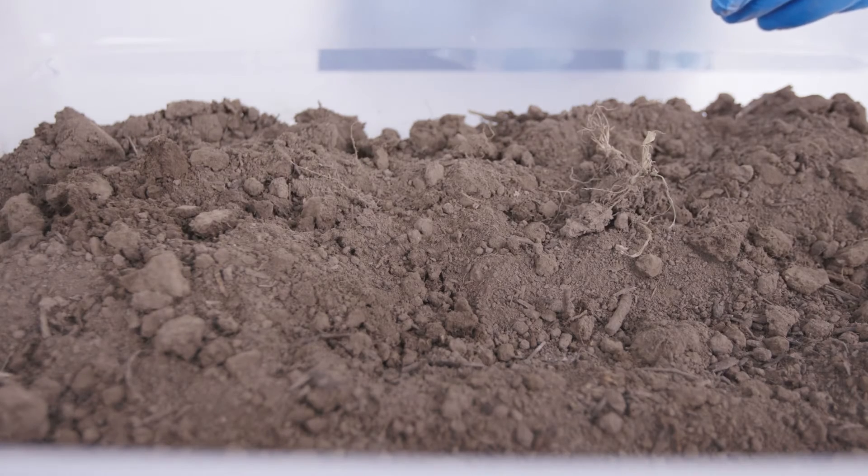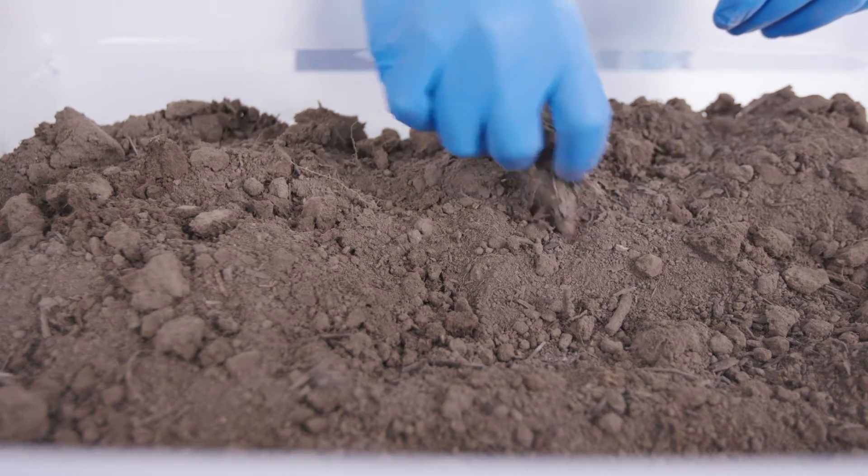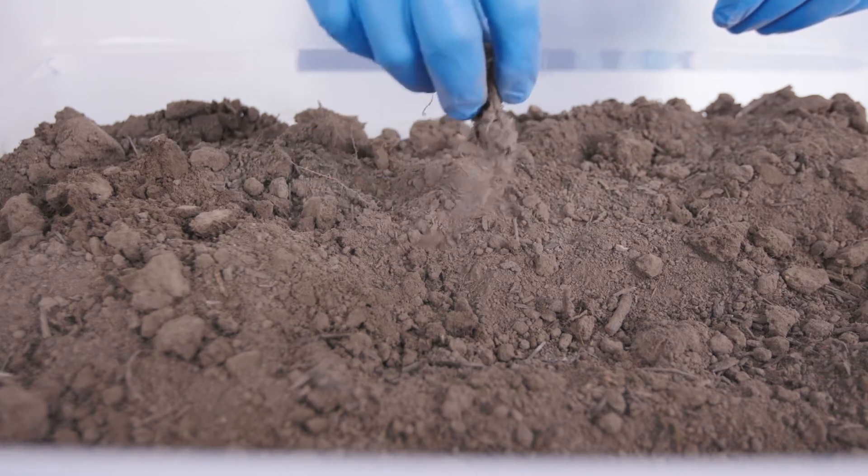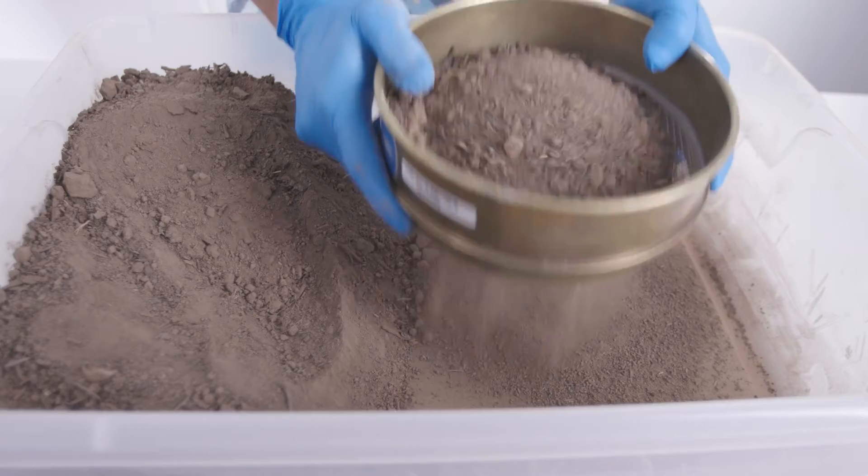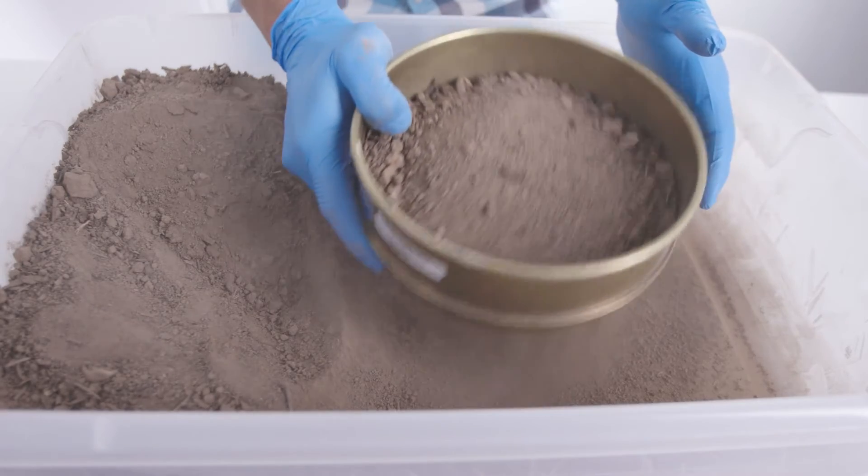Large rocks or other objects can complicate the calibration process. Remove the rocks, grind the soil, and run the soil through a 2 mm sieve before proceeding.